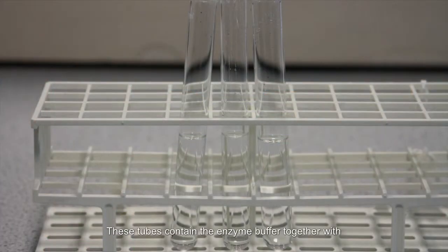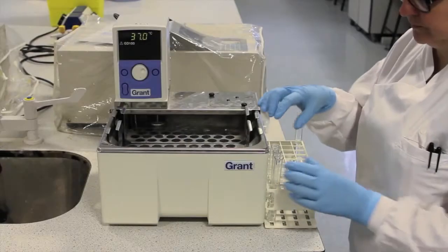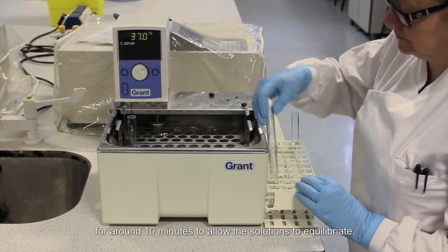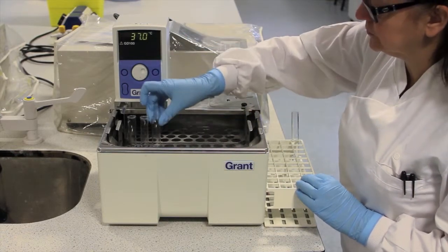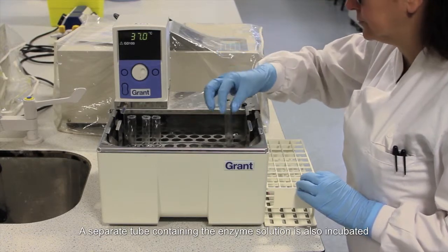These tubes contain the enzyme buffer together with increasing concentrations of the enzyme substrate, so that we can investigate how substrate concentration affects the rate of reaction. To start with, all tubes are placed in a water bath at 37 degrees centigrade for around 10 minutes to allow the solutions to equilibrate. A separate tube containing the enzyme solution is also incubated.